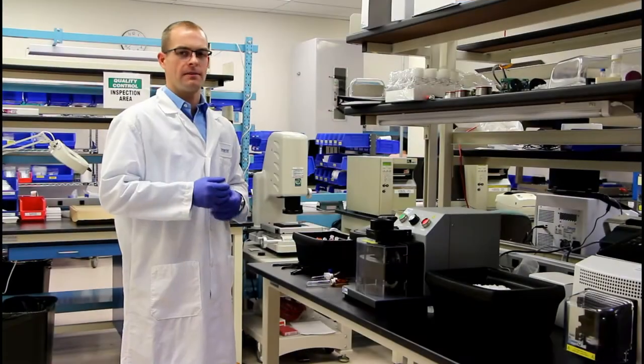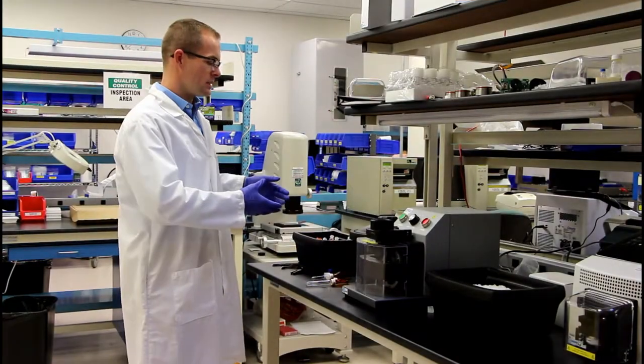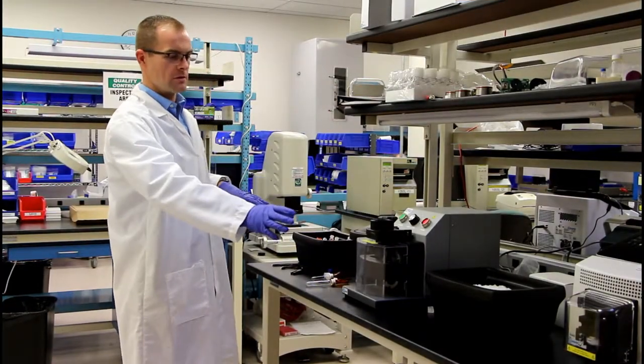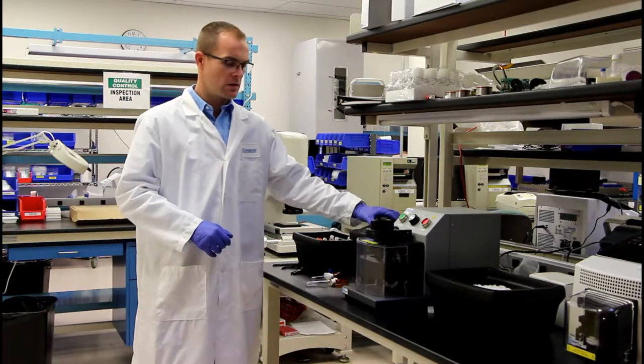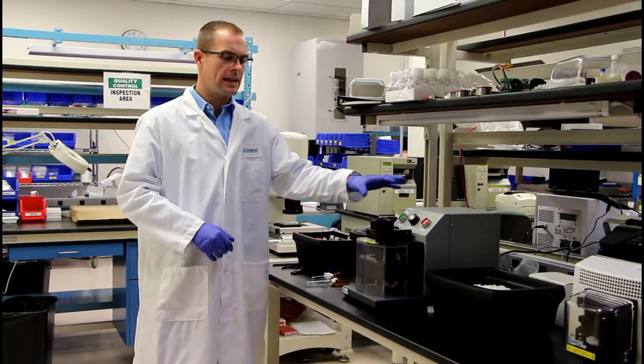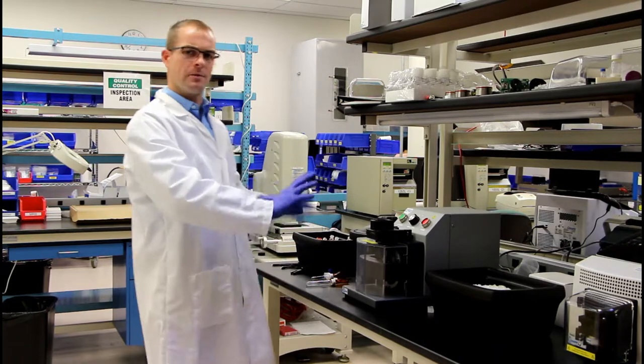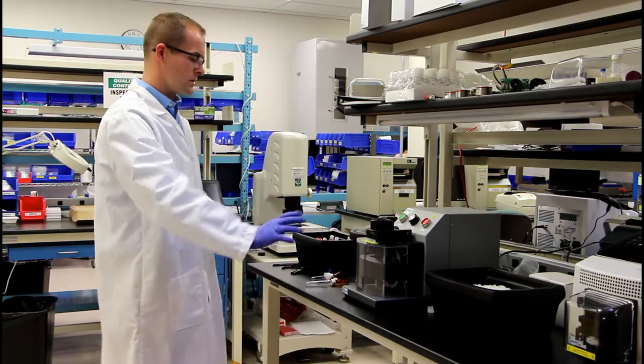So the first setup that I like to use is an approach with two separate dewars for ice, a dewar for my liquid nitrogen, and the instrument kind of in the middle of the whole situation here.